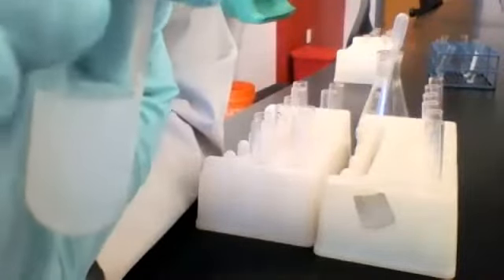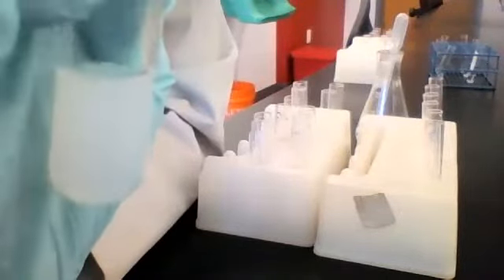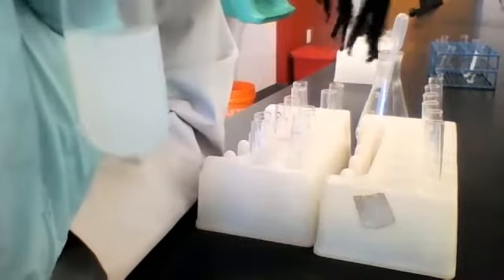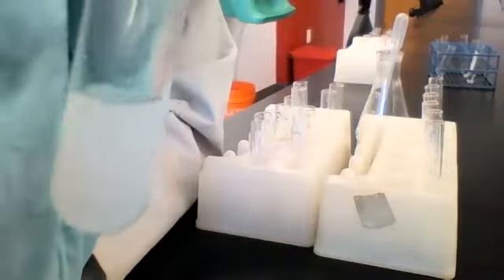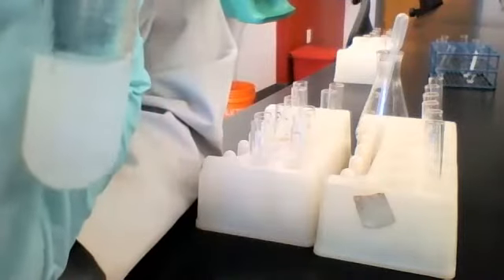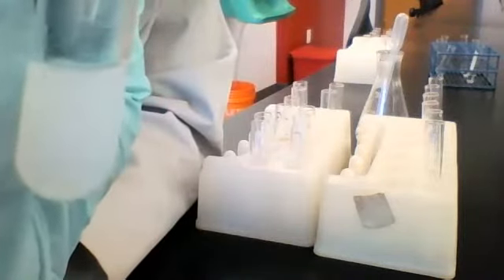To me, this white is not as, how do you say, I don't want to say thick, but like vibrant, you know? It's a real pale white. All right, so that's your observation for that one.